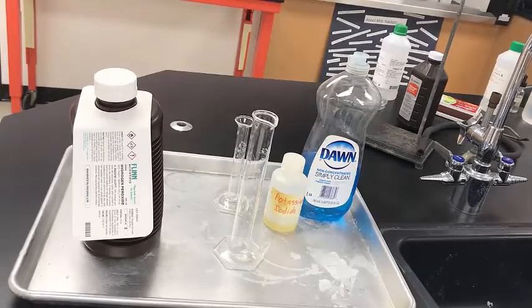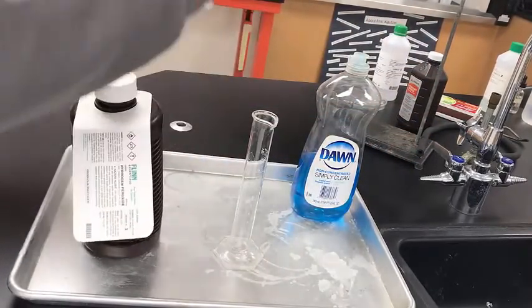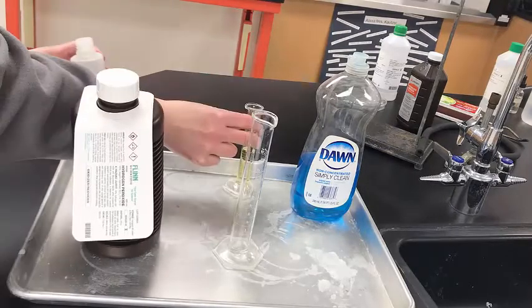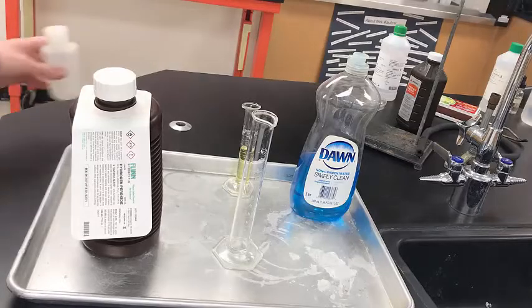Okay, so our directions say to measure out 5 milliliters of potassium iodide. That's this solution here. And I'll put that in a graduated cylinder and just set it aside. Okay. So potassium iodide is something called a catalyst. It kick-starts the reaction, just gets it going, but it's not actually what's being reacted. So hint, hint, the question there, do you include that in the chemical reaction? No, you don't, because it's not in the reaction.